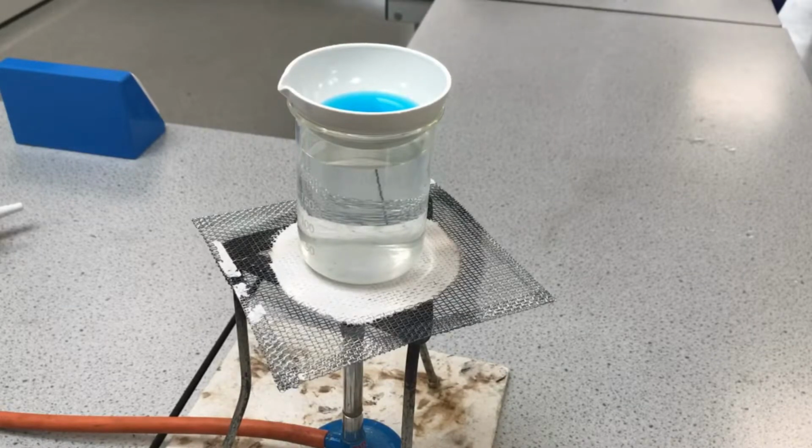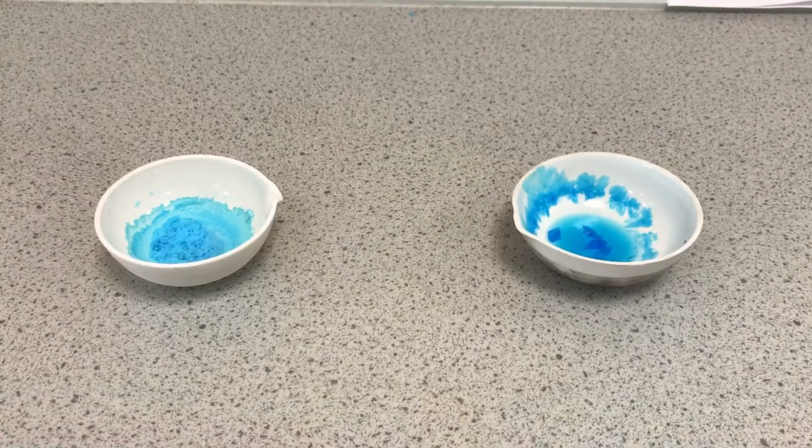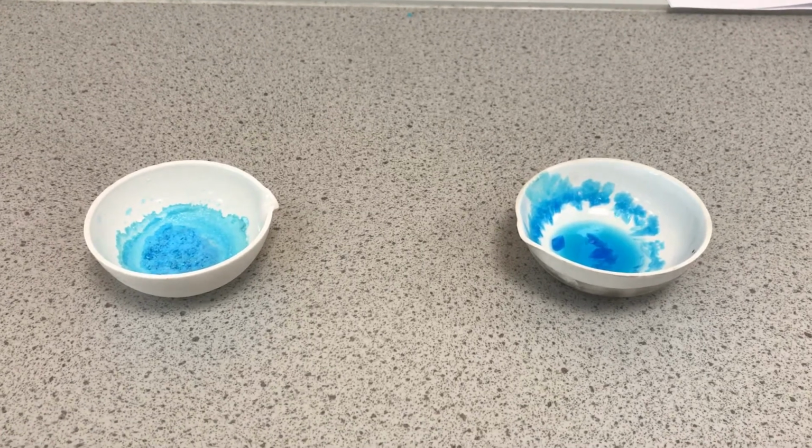Okay, and they're going to be pure if you've made the sulfuric acid the limiting reactant. If you've used excess copper oxide, that's how you're going to get a pure sample. Okay, so think about what you're doing, why you're doing it, when you're explaining your 6 stages to get your 6 marks of making this copper sulfate. We'll have a look at that when we've got some crystals. See you shortly. Okay, here we've got our copper sulfate crystals.